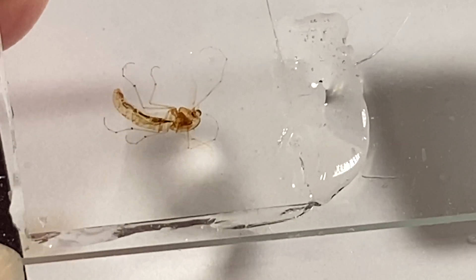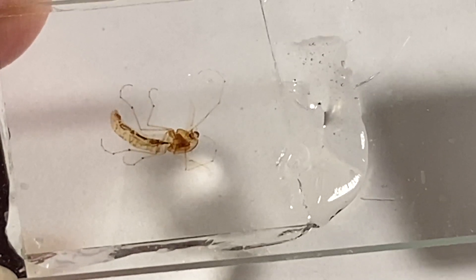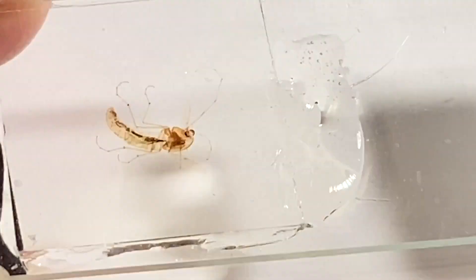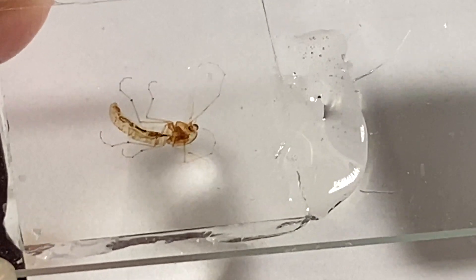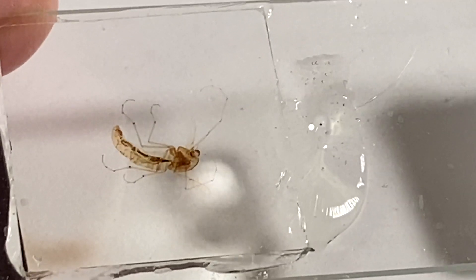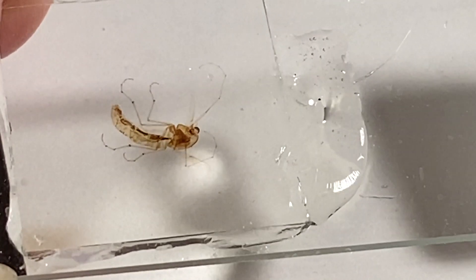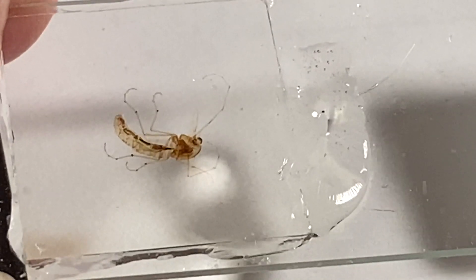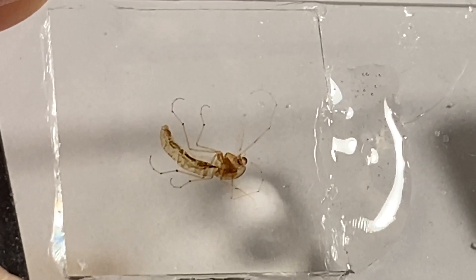As the resin starts to cool down, it's going to suck some of the resin back under. That's why I put a little bead of it along here — so that when it needs some to fill up the space as it's drawing it back, you have some resin for it to use. I've rescued about a hundred of my previous slides that I thought were ruined and they all worked very well. It's not a hundred percent, but it's over 99%. So I'll take those odds rather than having what I consider a less-than-professional-looking slide.